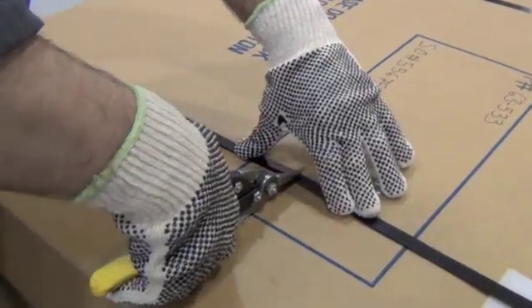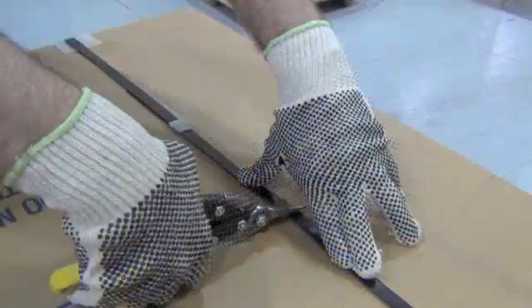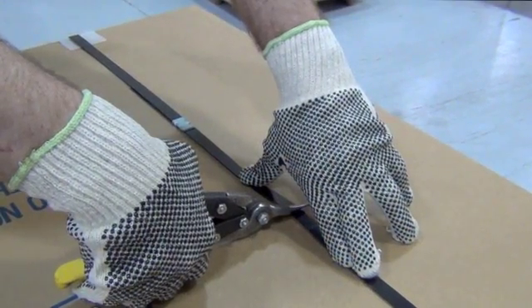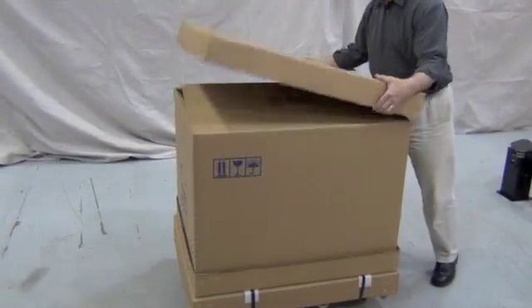To break the banding, tin snips are the best tool. Exercise caution, the strapping may spring back when cut. Dispose of the strapping properly.